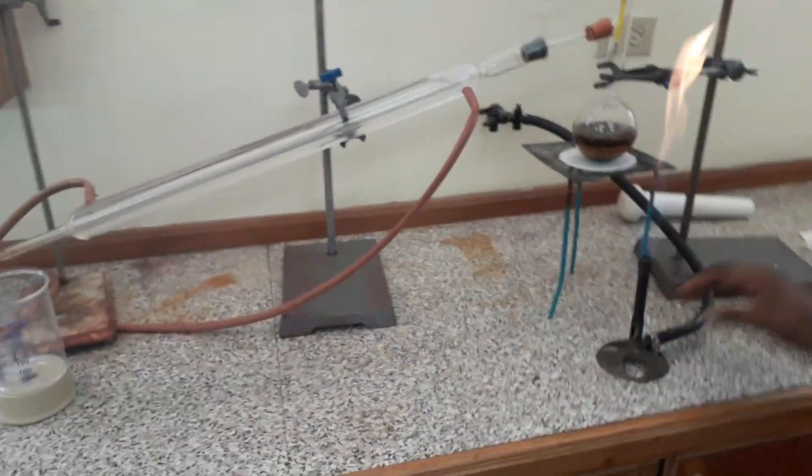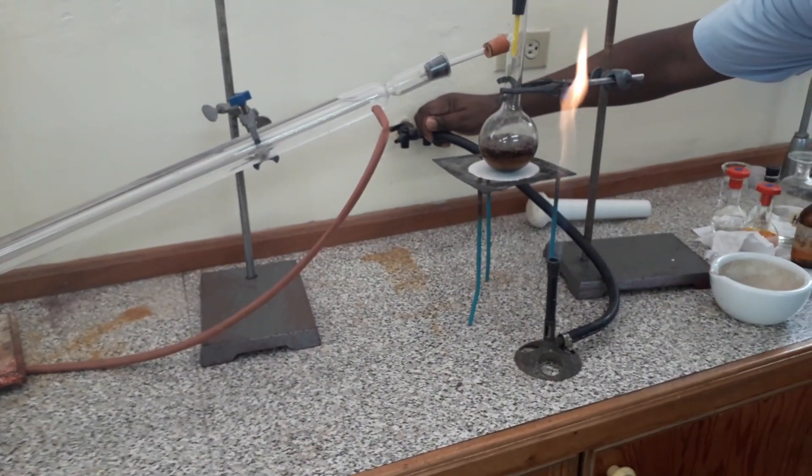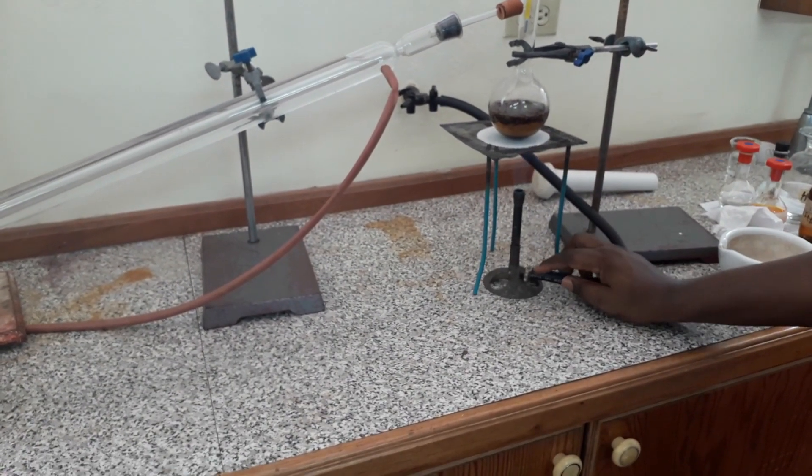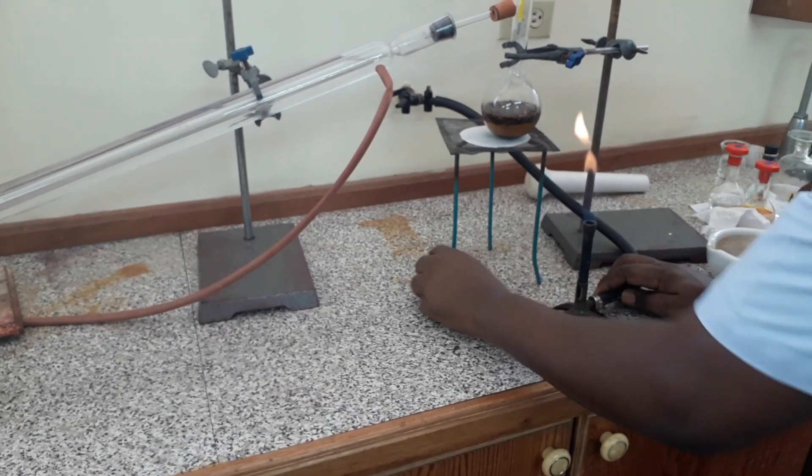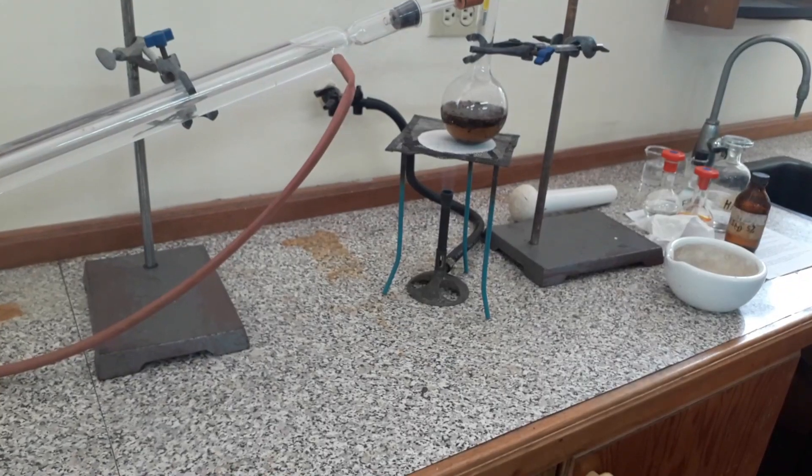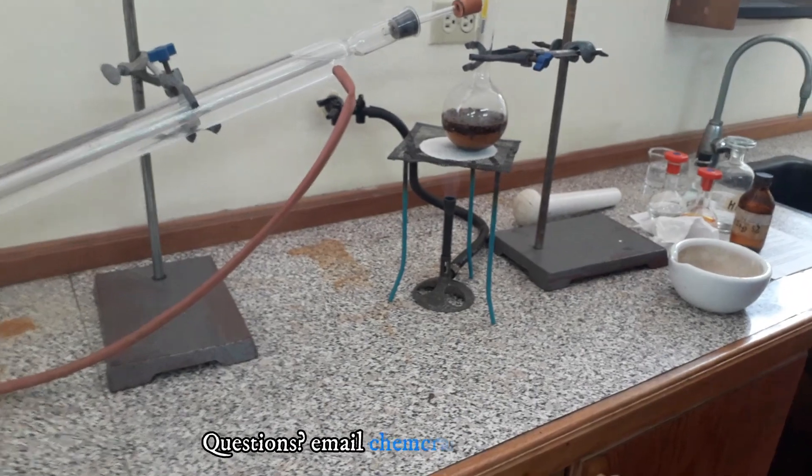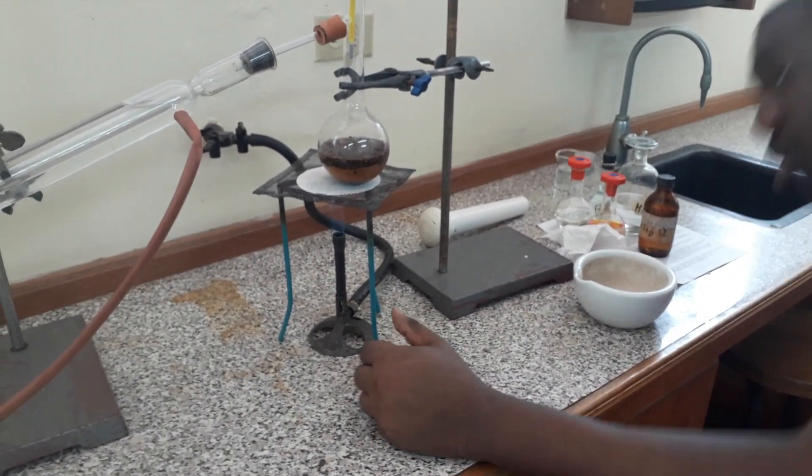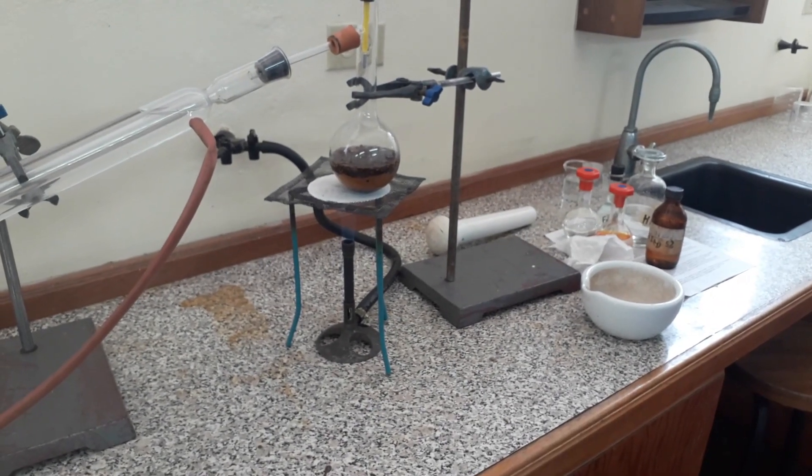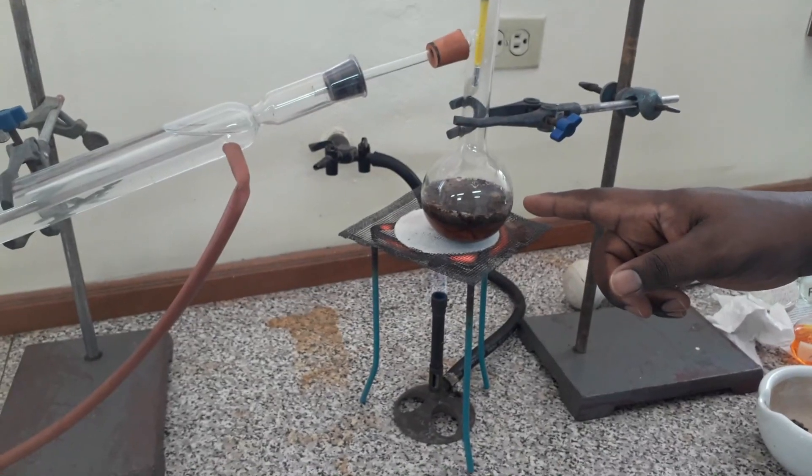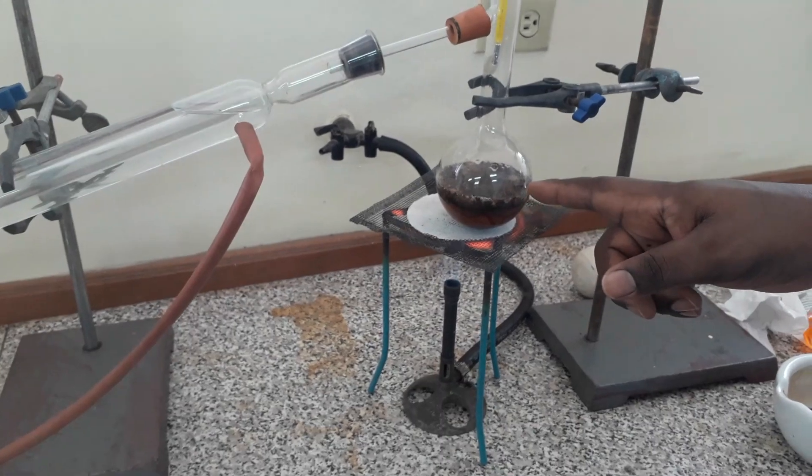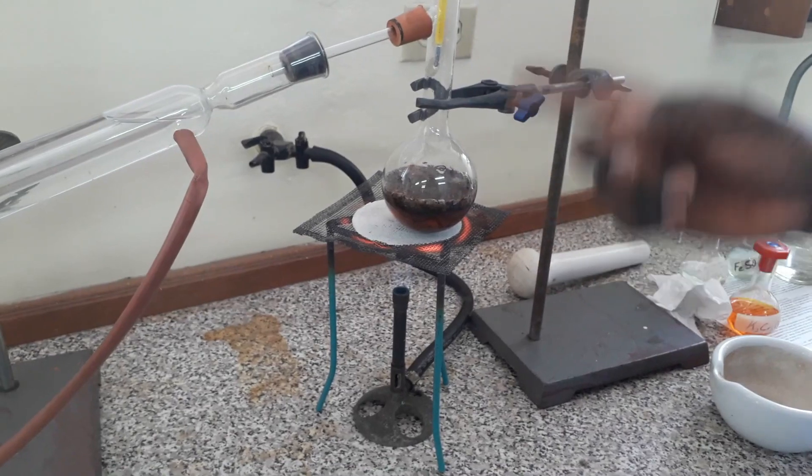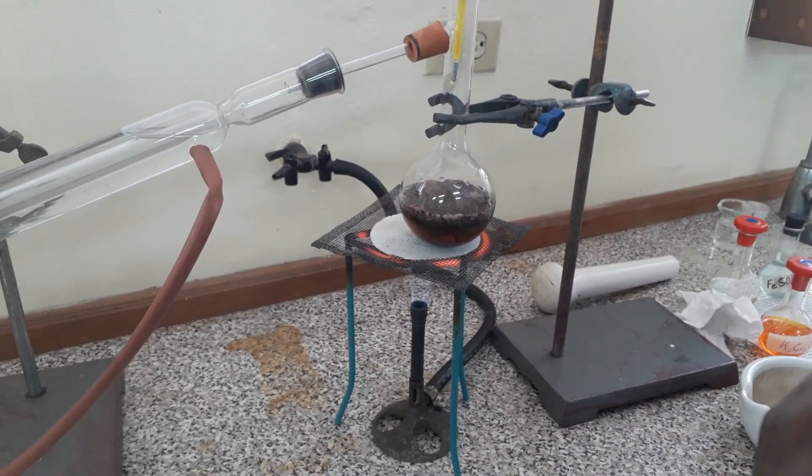We allow that to come up to temperature. You're seeing it's starting to bubble up now. And we have to be careful. Watch it carefully so it doesn't go over into the condenser, boil over.